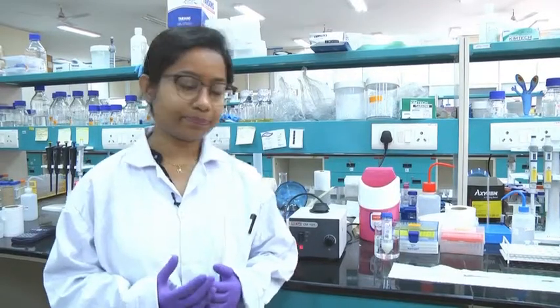Welcome back. Today in the NPTEL experimental biochemistry course, we will learn how to isolate and characterize protein. If you are working in a biochemistry lab, you might find that you need some protein for your own experiment. We will go through the basic steps of protein purification from a source. There is no single hard-and-fast technique for isolating a particular protein — depending on the protein, you need to modify the protocol, but mostly the basic principles will be the same.